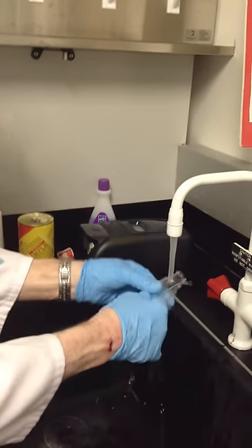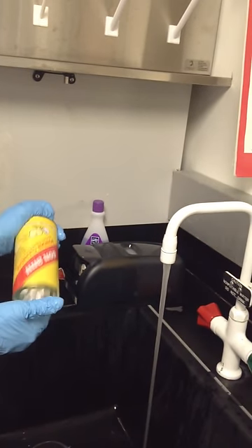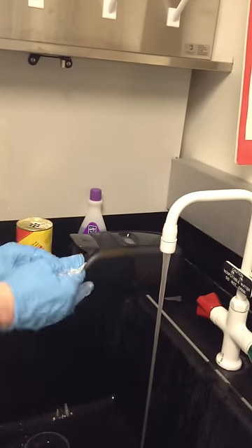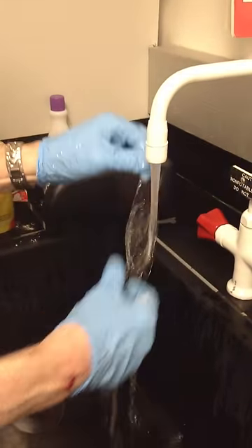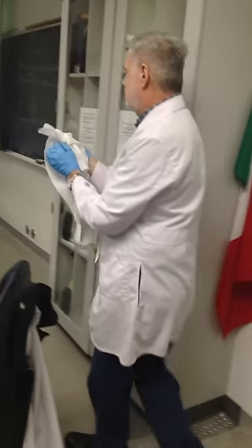After you rinse it, if it's still withdrawing you'll need to do it a third time. It's better — sheeting off — but still not terrific. Then dry it well.